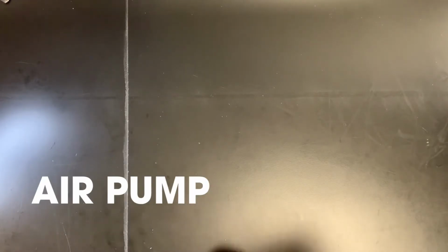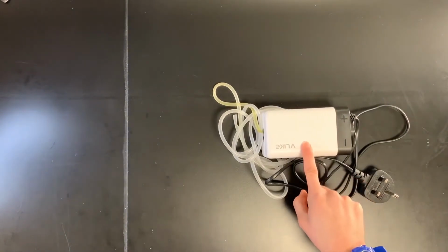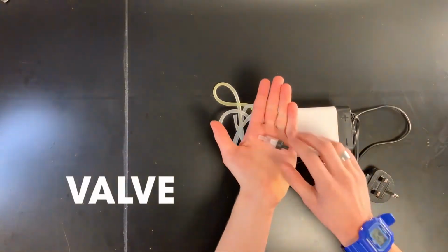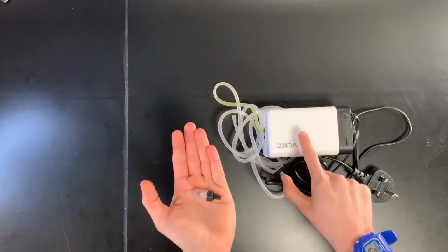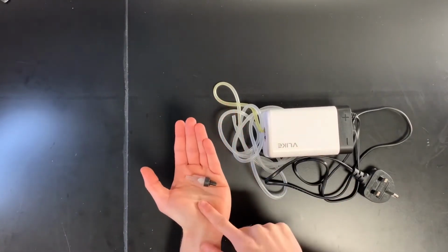Well, the first thing we're going to need is an air pump. Now, an air pump like this you can find in any pet shop or any aquarium shop. The second thing that we're going to need is a one-way valve. Now, this is really important because we don't want any water getting into this pump. And one of these valves is going to make sure that that doesn't happen.